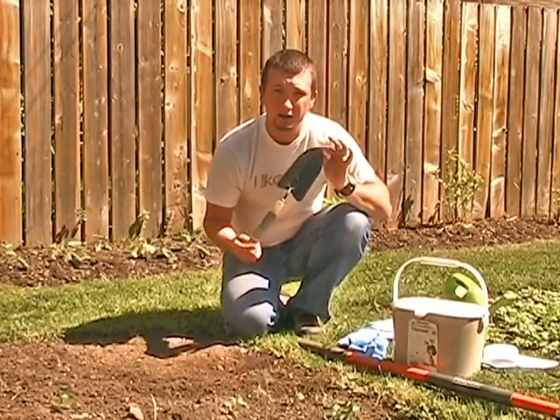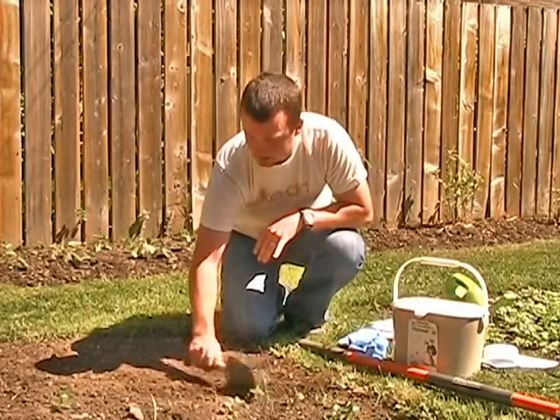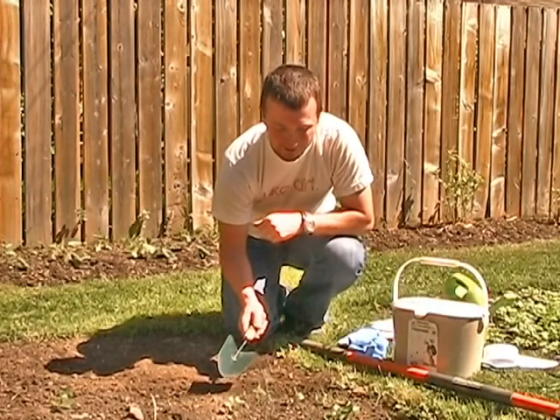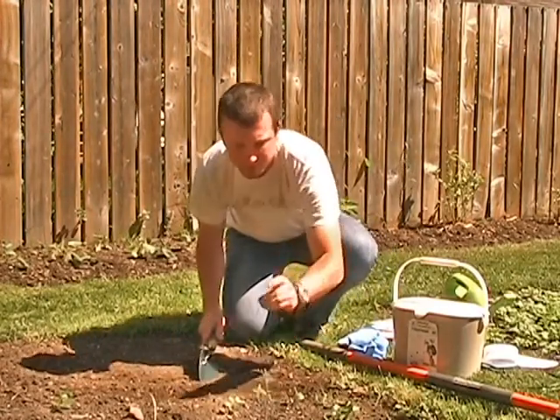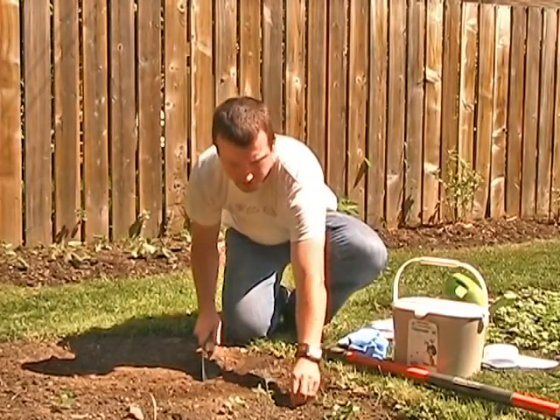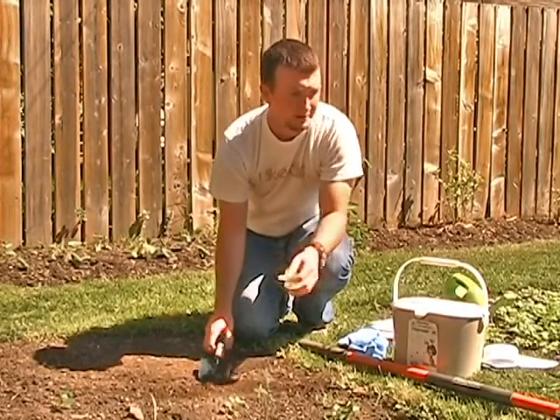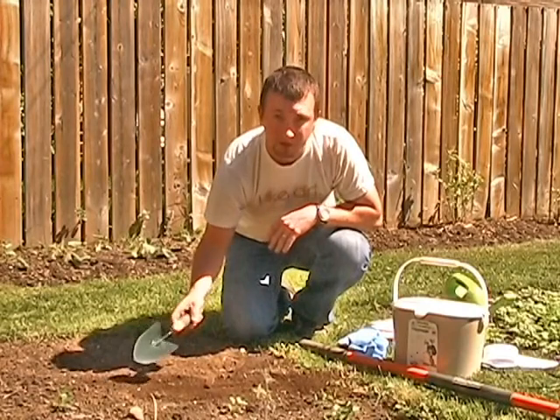Now that we've got our clean trowel and we're ready to go, you want to make sure that the surface you're actually going to be sampling is free of any plant material, because we're not taking a plant sample — we're taking a soil sample. You might have little Manitoba maple seedlings, or in this case I've got some cilantro that has reseeded from last year. You want to remove that and get a nice clean soil surface to sample from.